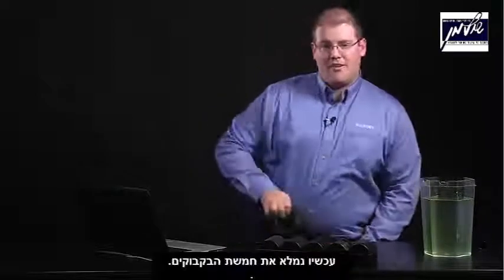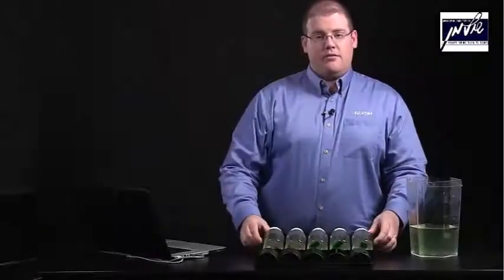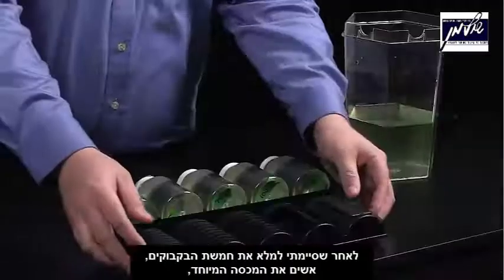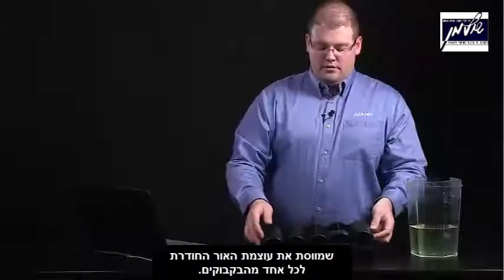Now we will fill the primary productivity bottles. Now that I have finished filling each of the bottles, I'll place the cover on it, which allows different amounts of light through to each bottle.